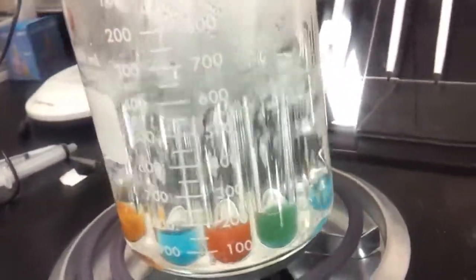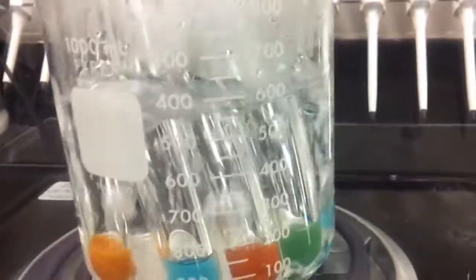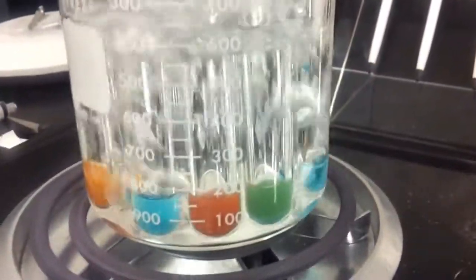So, once again, we have three solutions that have performed a positive test for Benedict's solution, and I will put up the final product picture after our movement. Thank you very much.